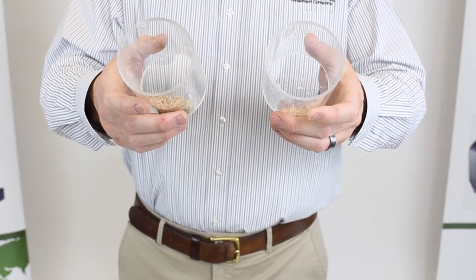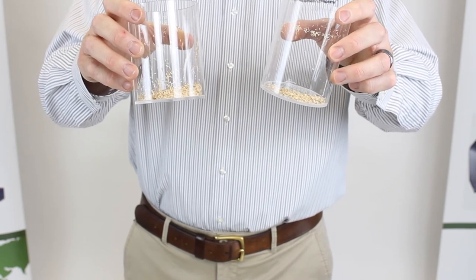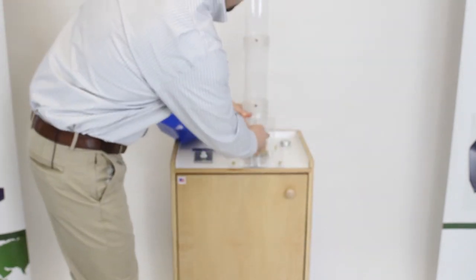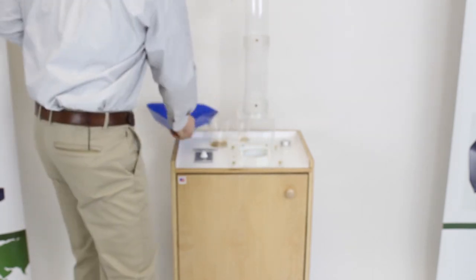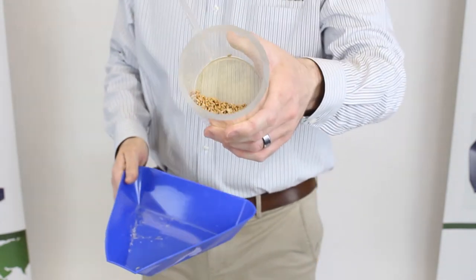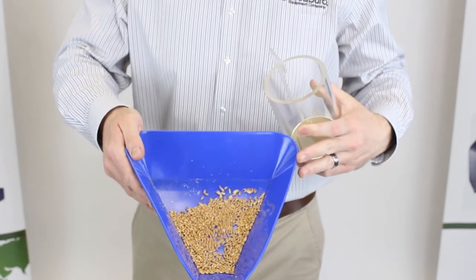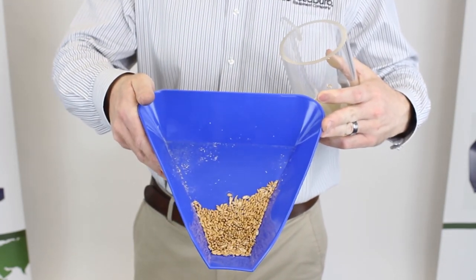Some debris and chaff in our top cups. We've got our larger heavyweight seed in our lower cup.